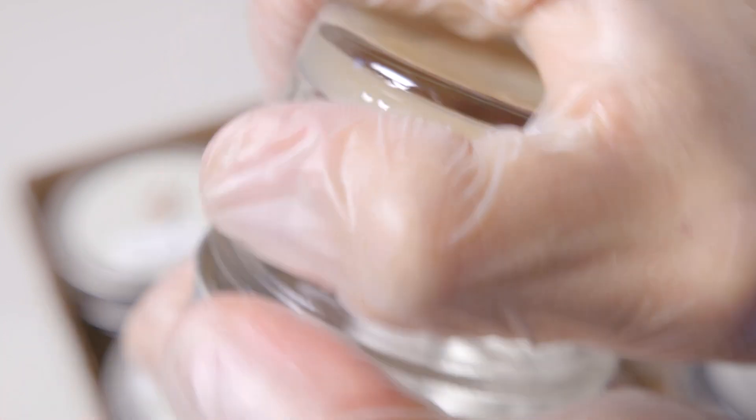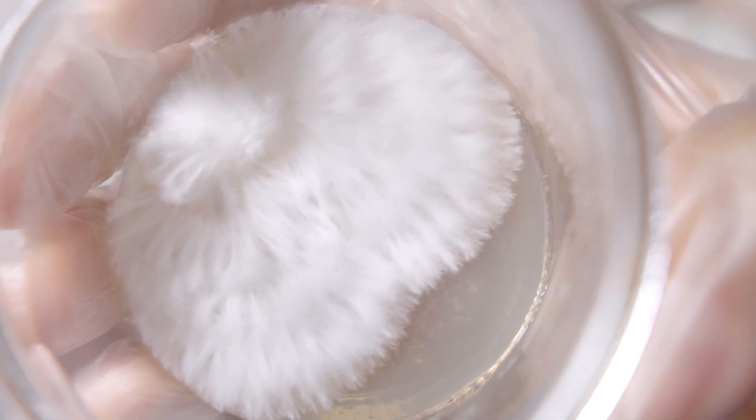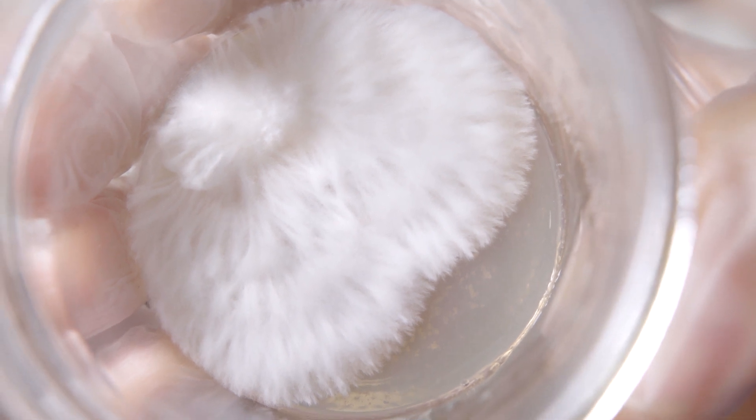Now it's time to have a look at our third plate and see how we're doing. And from what I can see, we have a single isolate. This is ready to go into one of our slants.